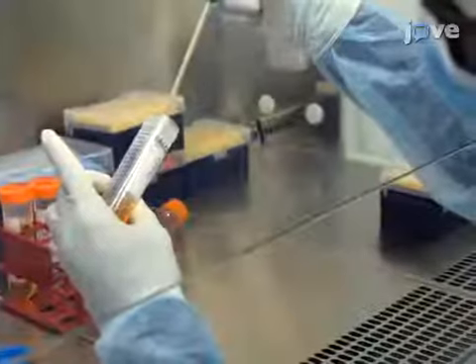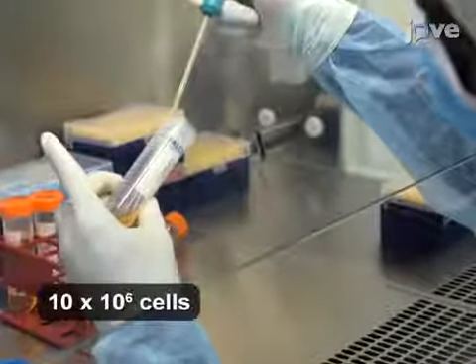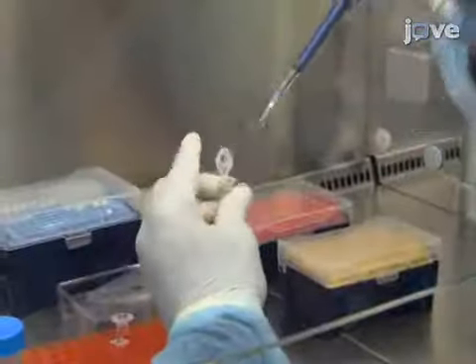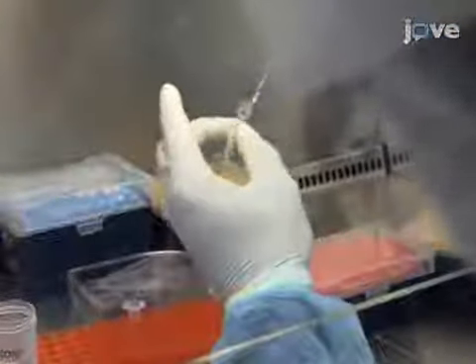Aspirate the supernatant and, with 100 microliters of 0.25% trypsin-EDTA, gently resuspend the GSC pellet. Then incubate the cells at 37 degrees Celsius for 3 minutes. Next, add 10 microliters of 20 millimolar calcium chloride and 2 microliters of 10 mg per milliliter of DNase-1 to the tube.